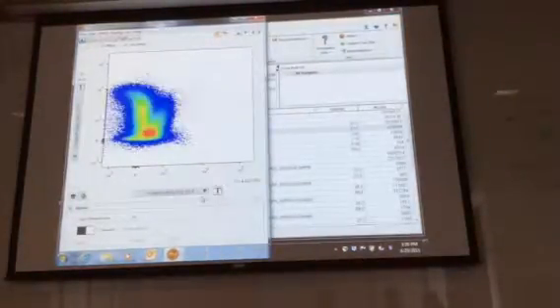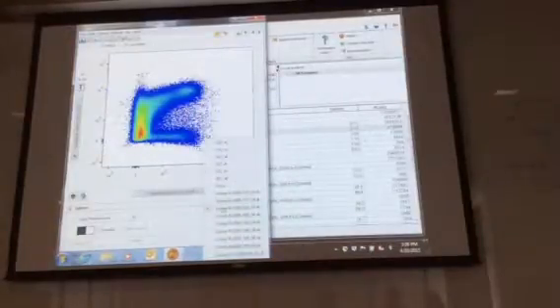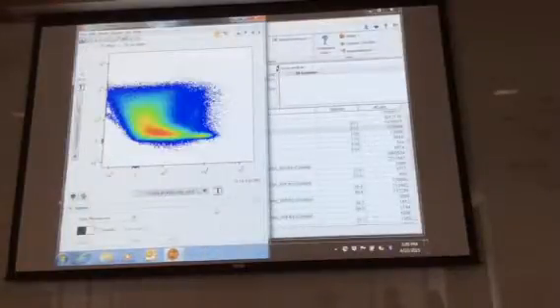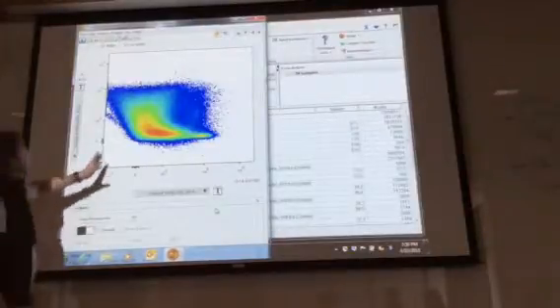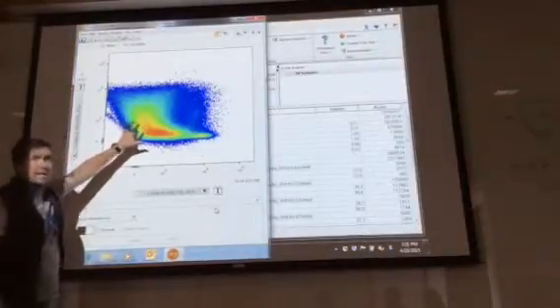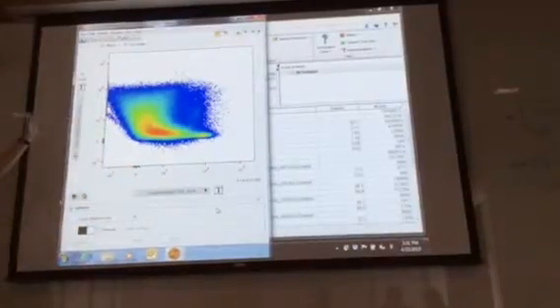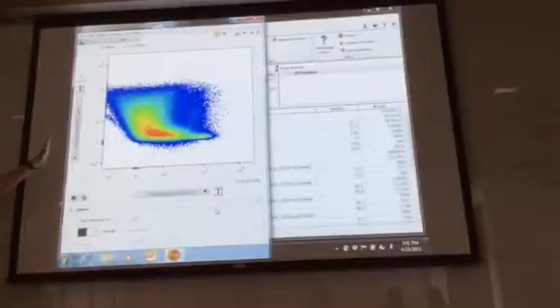So you check by looking at the normal samples? Yeah. Well, I'm trying to find something that doesn't really compensate correctly. Okay, so something, this is okay, but not great. So if you were to look at the samples, things that go off at 45-degree angles are generally bad.